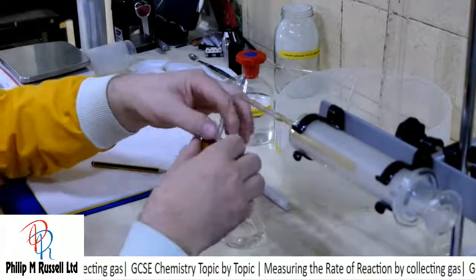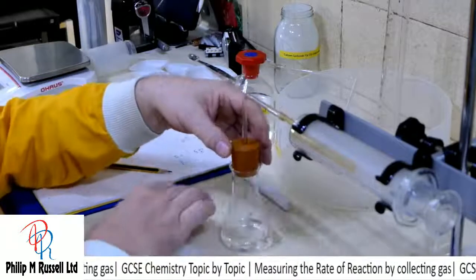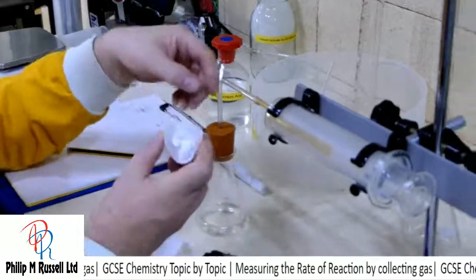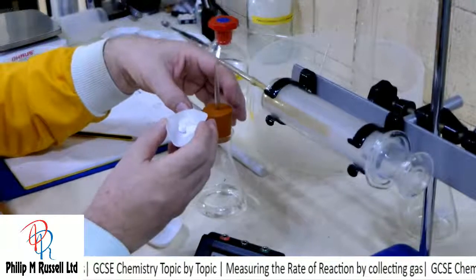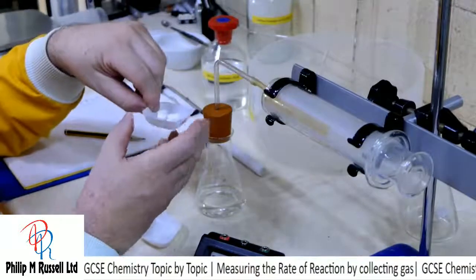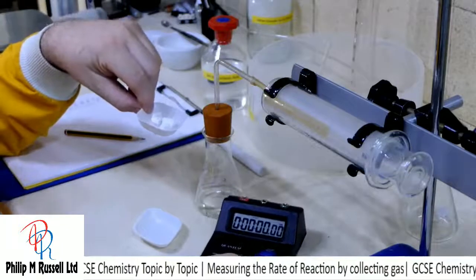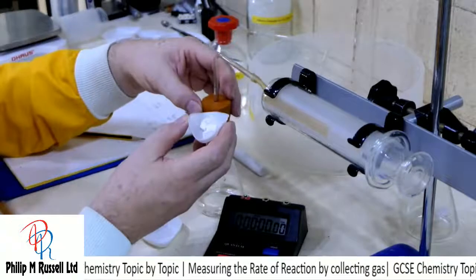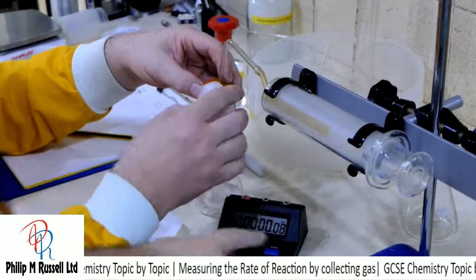So I've got my bung ready to go in. I've got my pieces of chalk ready, and we're going to start the timer. You can't quite see that timer. There we are. You can see the timer now. Ready? 3, 2, 1, go.